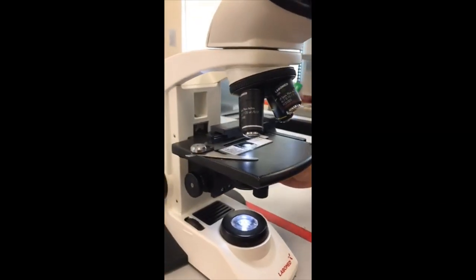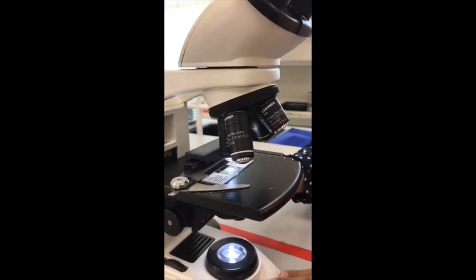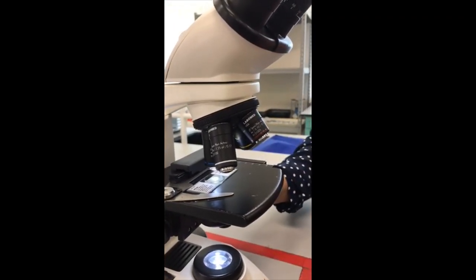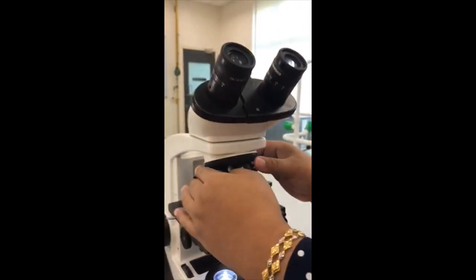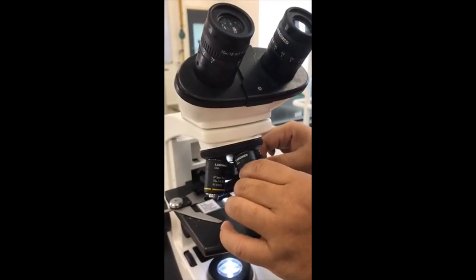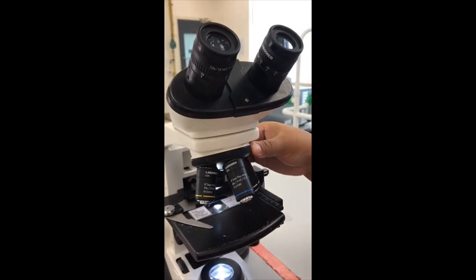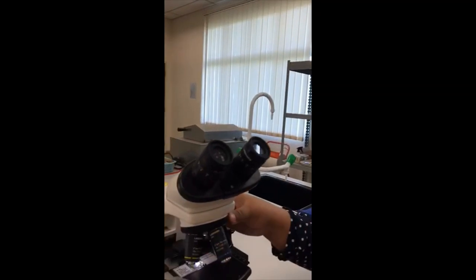I'll make sure that the light source from the illuminator is passing through my specimen. From here, I want to show you the objective lens — there are four of them.